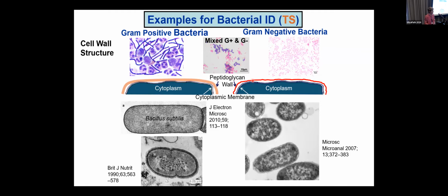Here are examples, real examples of bacteria. On the left are gram-positive bacteria. We have a rod. You see this dark area around the outside is the cell wall, and it's fairly thick. There's a thick cell wall around this coccus. These are round bacteria or spherical bacteria that are reproducing by fission. So you have almost two here. You will see that it doesn't have a nucleus. These things in the middle are lipids.